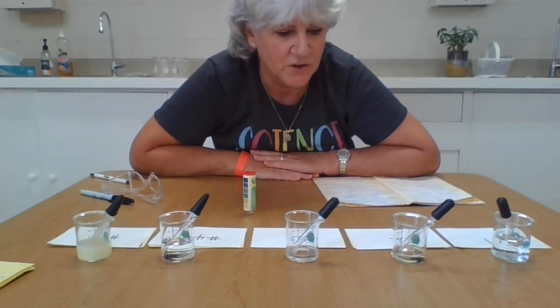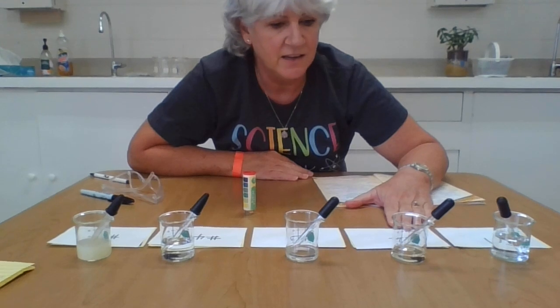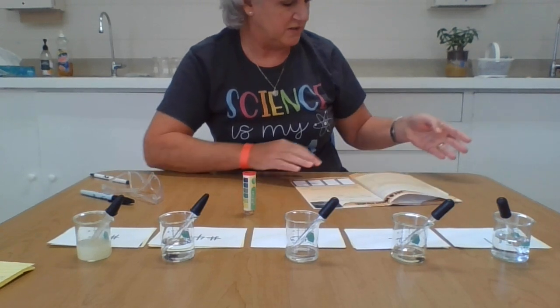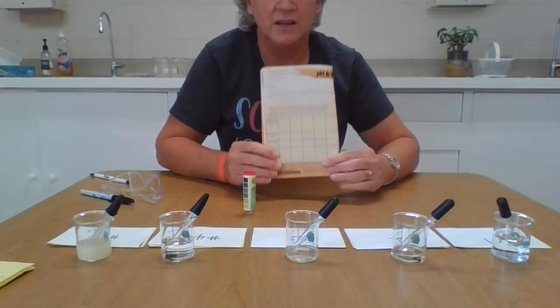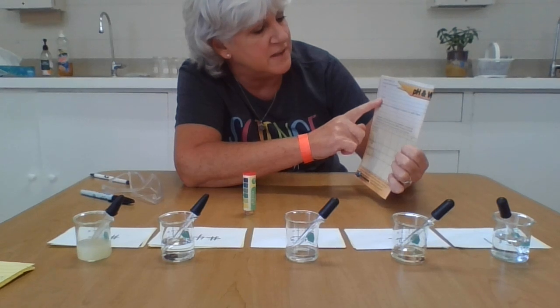Okay, so what I've got for you is 5 common household substances. I had them right here in the classroom, so I didn't go shopping or do anything special to get them. You're going to open up your notebooks to page 18, and at the top there is a place for you to test what you already know. So write down what you already know about acids. What do you already know about bases?